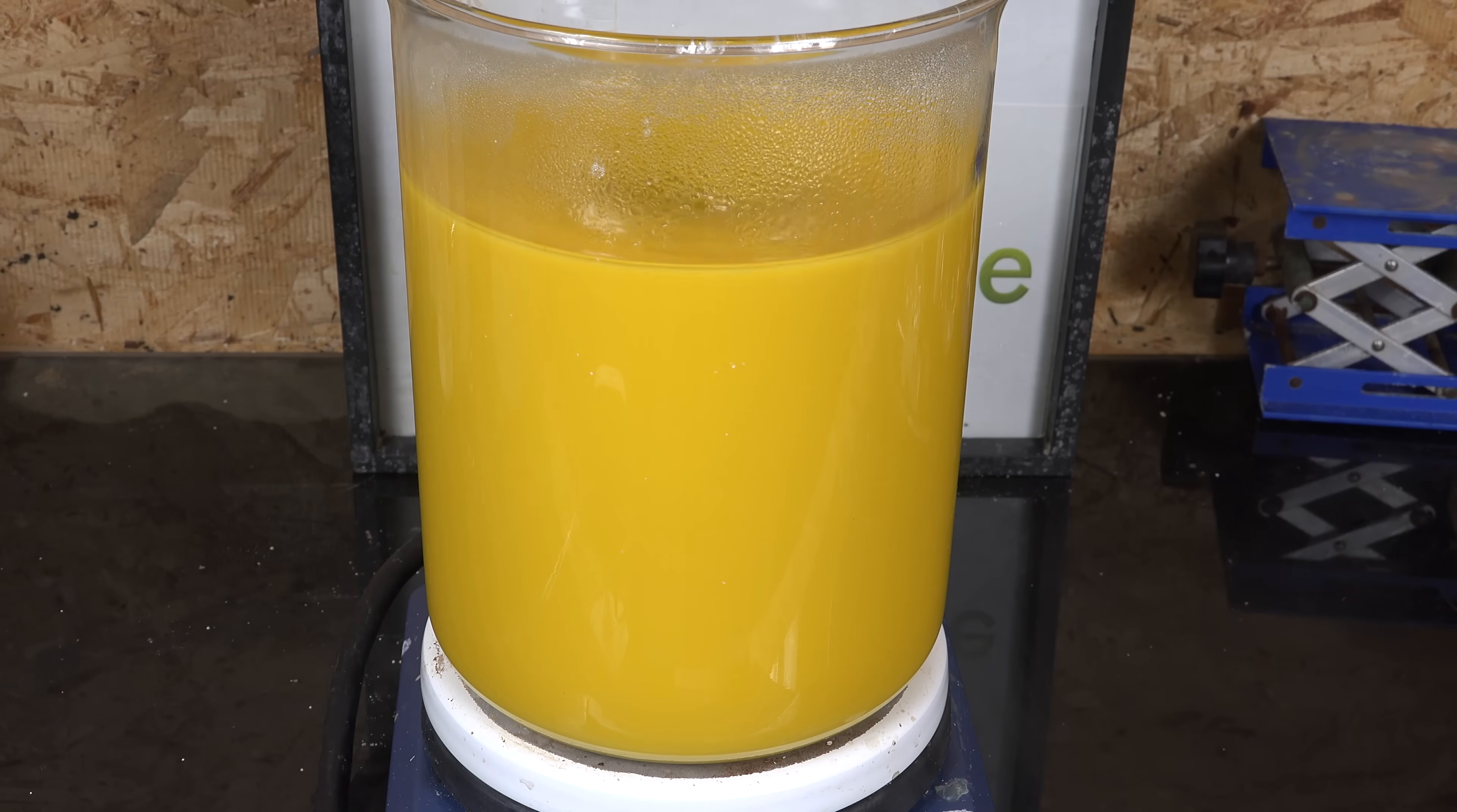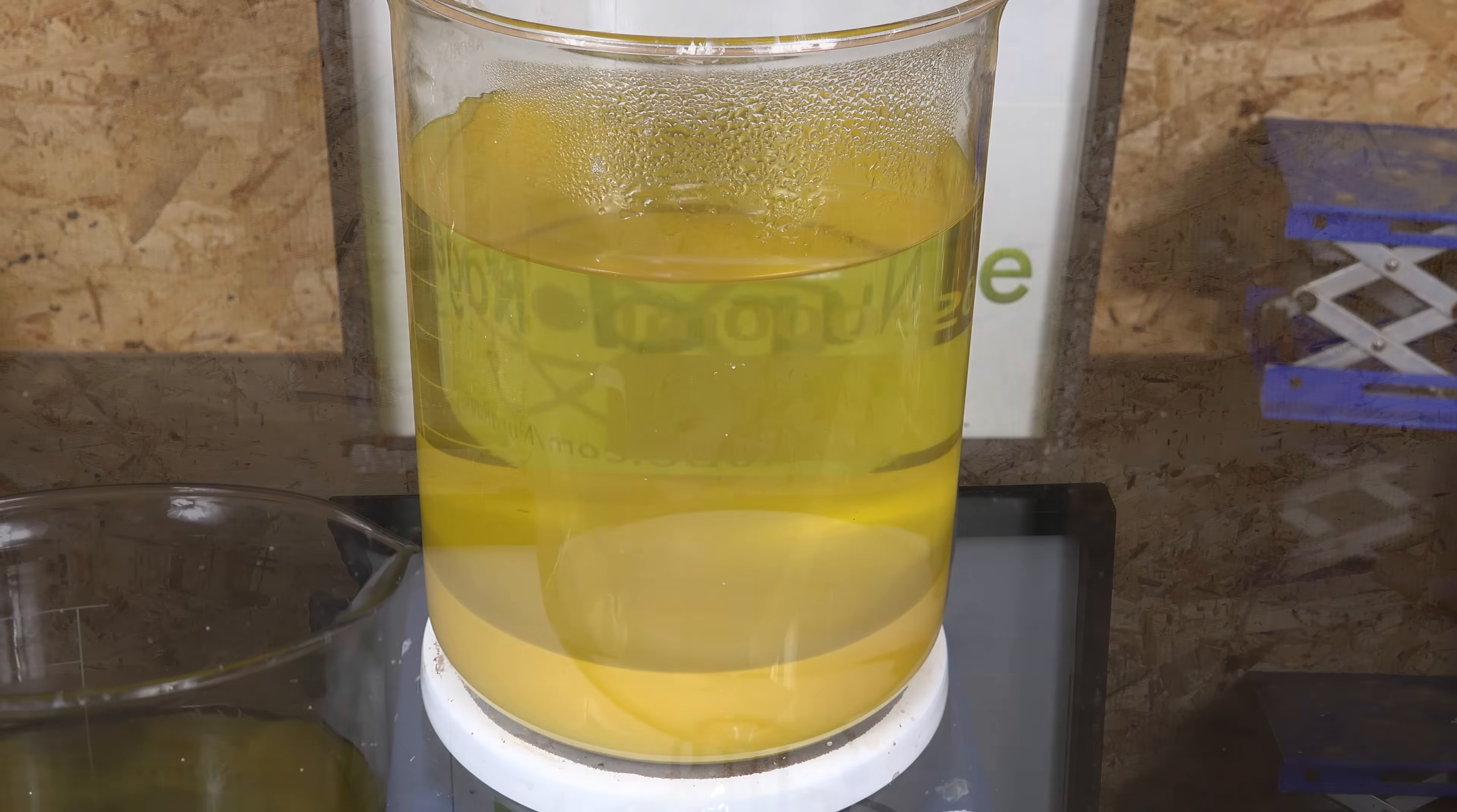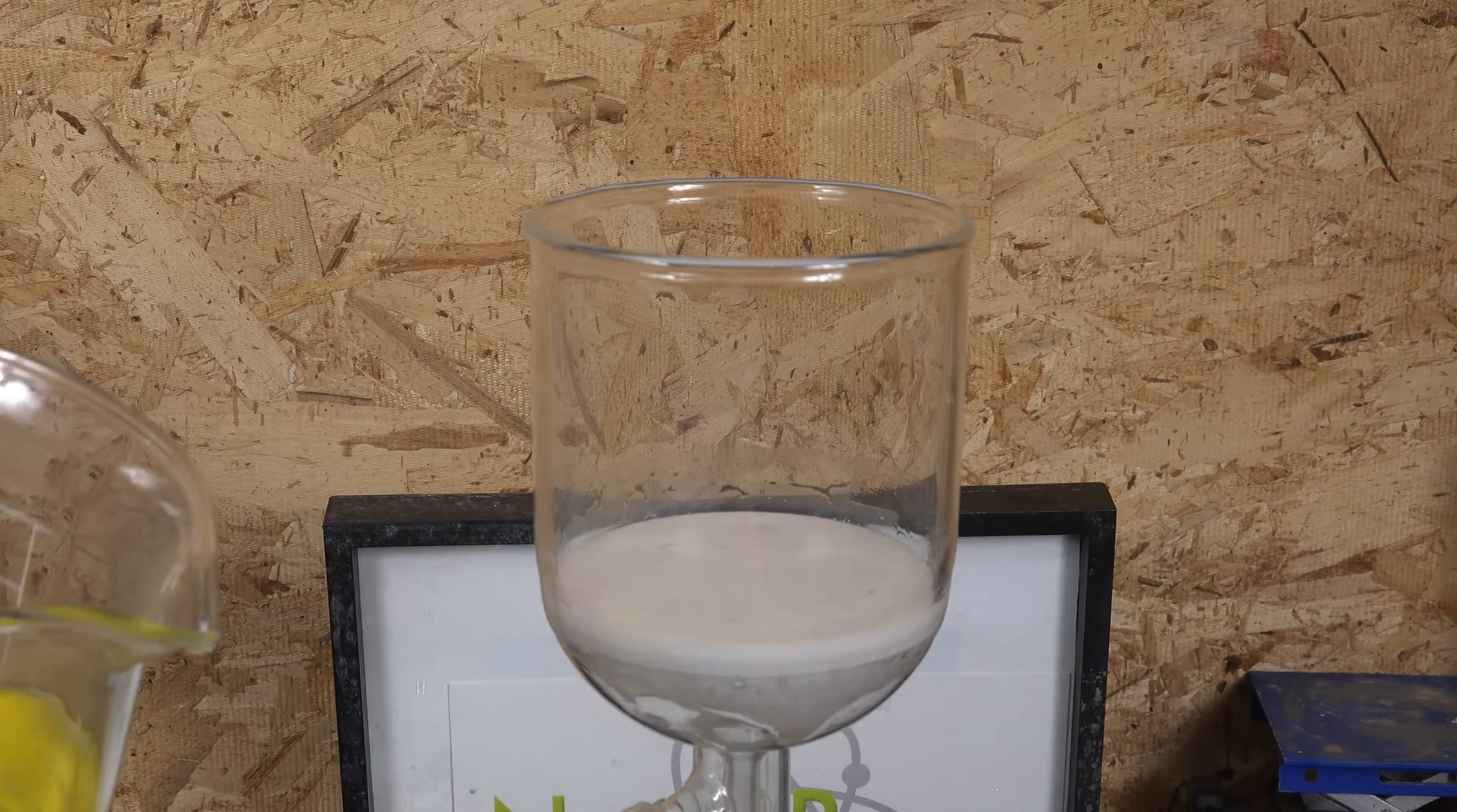Anyway, keep stirring until it cools and then let it settle. This is so that it's easier for us to decant and filter it later.